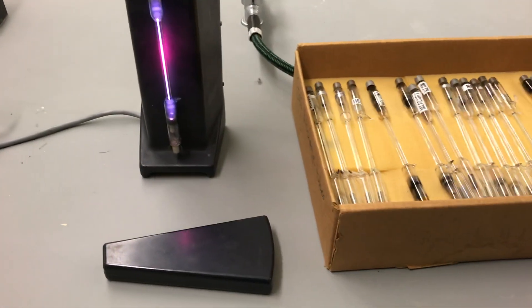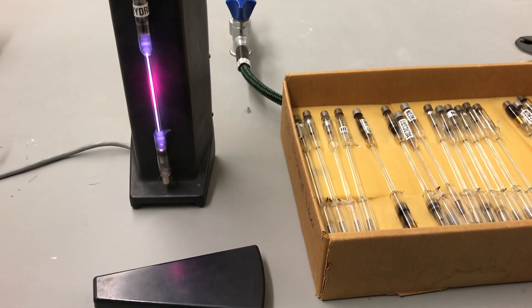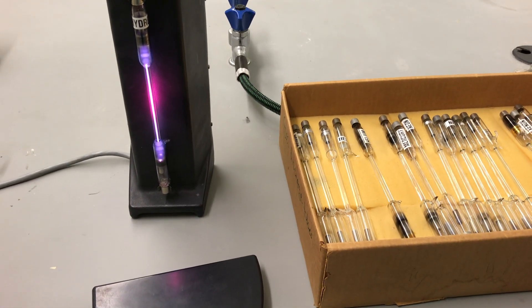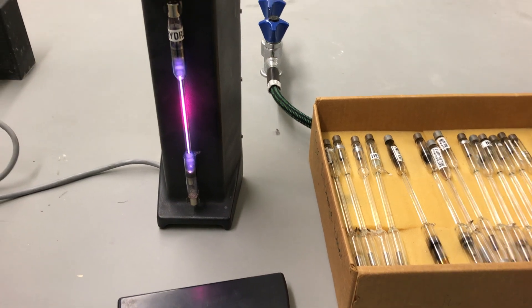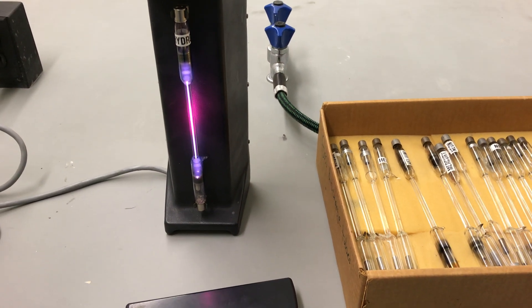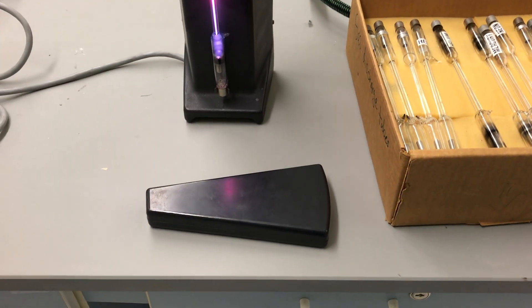Hello ladies and gents, welcome to our first part of our inorganic analysis lab. We're going to be viewing gas discharge tubes using a spectroscope.